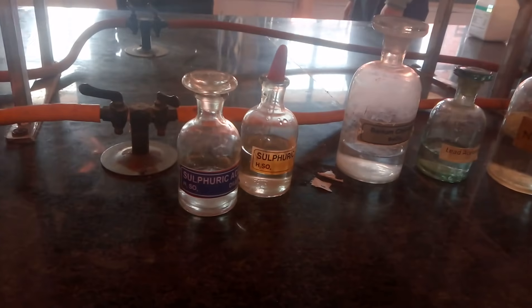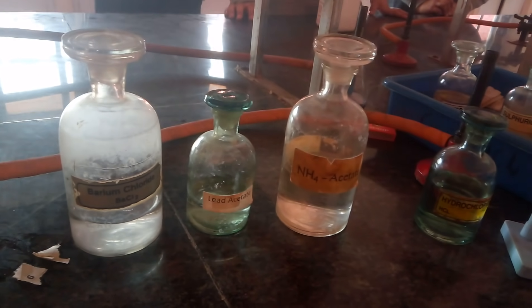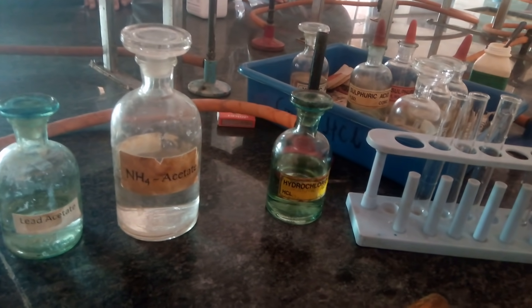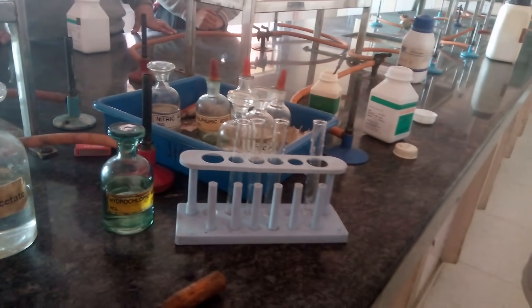The reagents that you require are dilute sulphuric acid, concentrated sulphuric acid, paper piece, barium chloride, lead acetate solution, ammonium acetate solution and hydrochloric acid concentrate. These are test tubes and that is the salt.